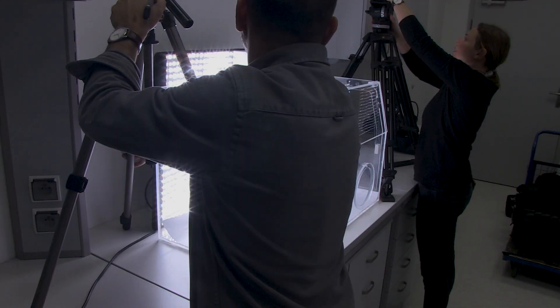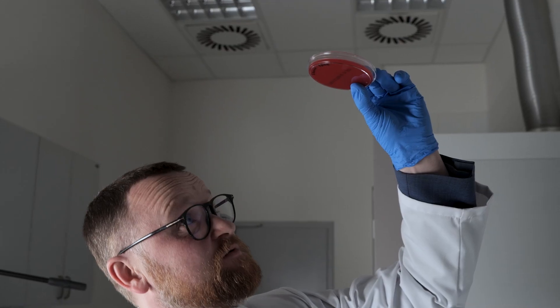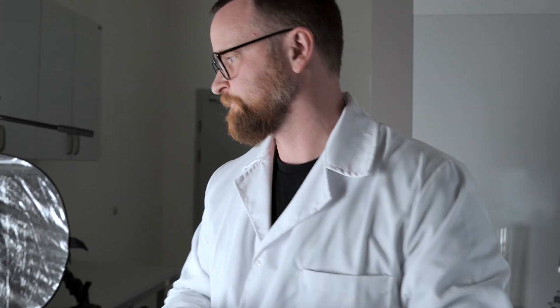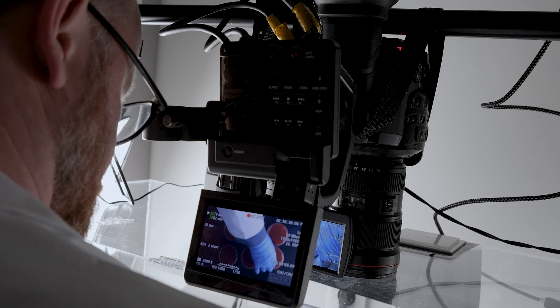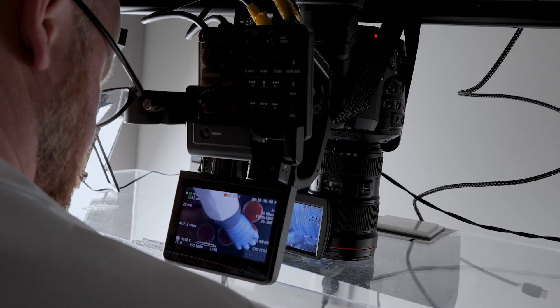To make it even more transparent, we have prepared the whole experiment without any cuts. We filmed it without any gaps in time, so you can investigate the whole process with us.